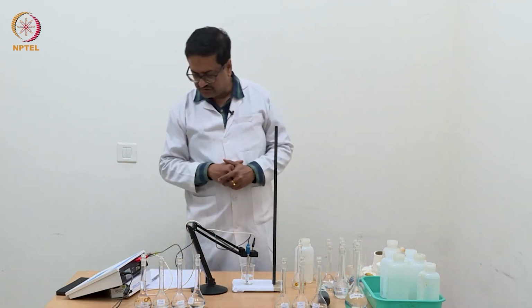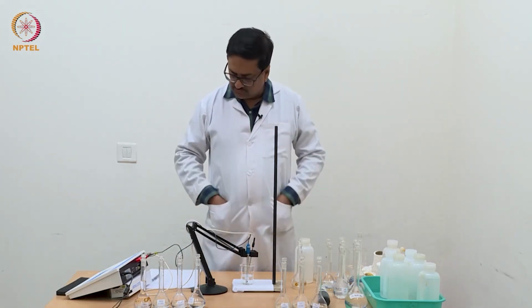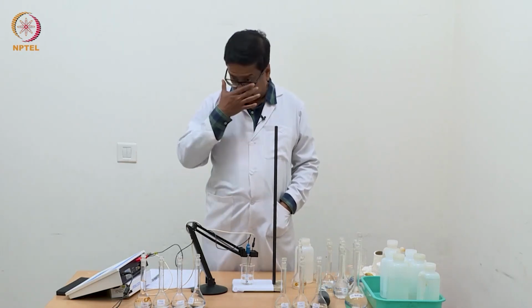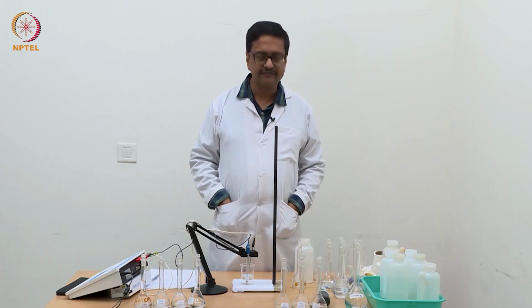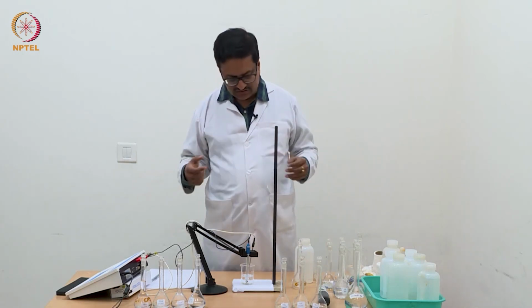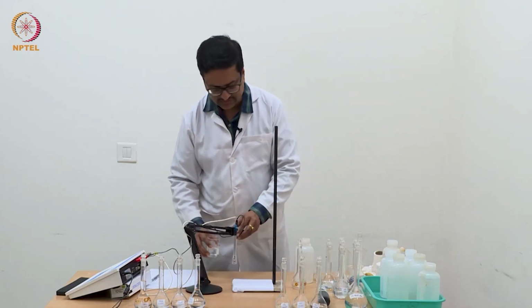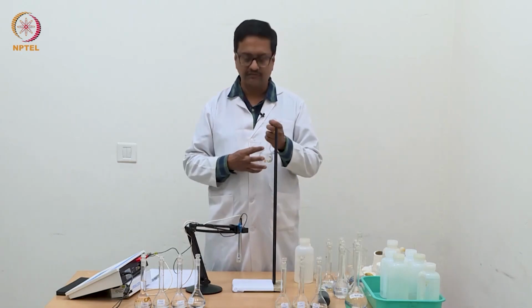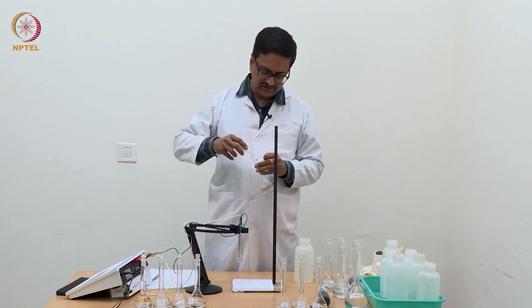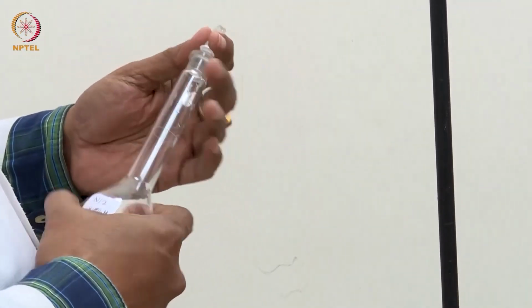So with this we end our experiment. I am going to plot these results using graph paper, and show it to you in the next class. So before we close today, I must again remind you that when you are using this kind of sophisticated instruments, we need to clean the electrode carefully after the use and make sure that the electrode functions as normal.